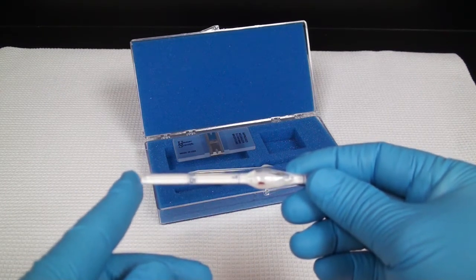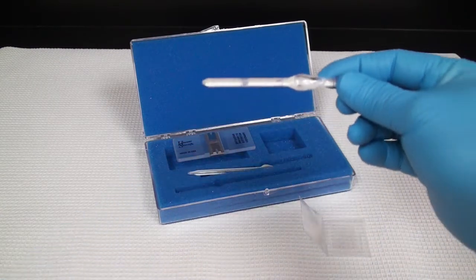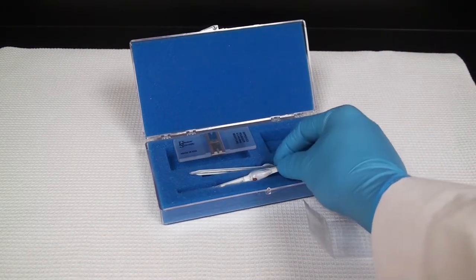I'm going to be doing yeast today and I'll be doing a manual 1 to 20 dilution using pipettes.